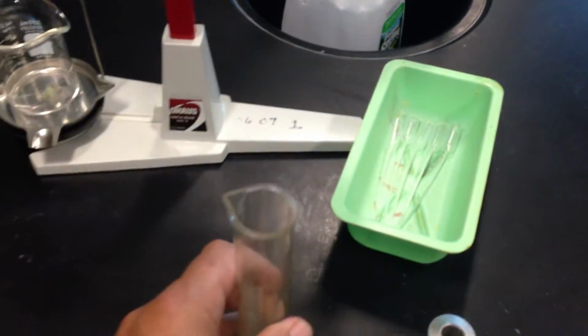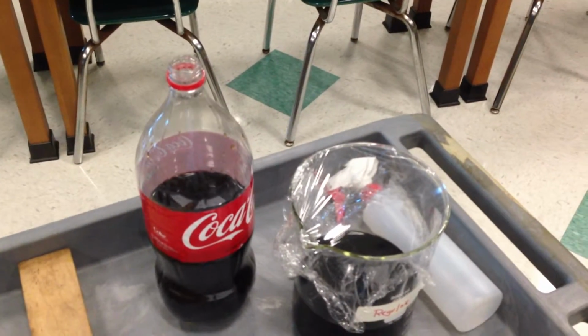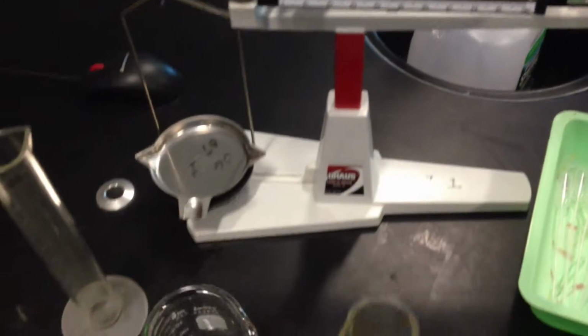All right, make sure that we wash out and try to dry these the best that we can. So wash out your beakers, especially with the sugar, Coke. Diet Coke and water is easily cleaned out, but this is the one when you use the sugar in the Coke tends to really make a big mess. So make sure you wash out your containers, because if you use dirty containers, okay, in this process, then you're going to contaminate your results.